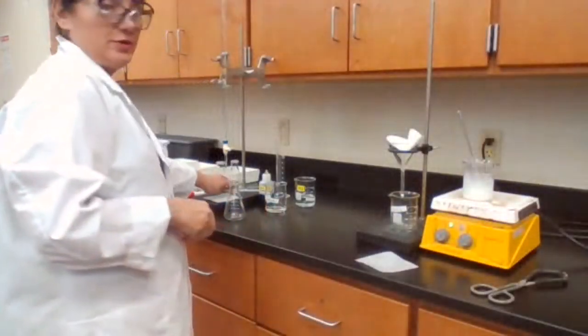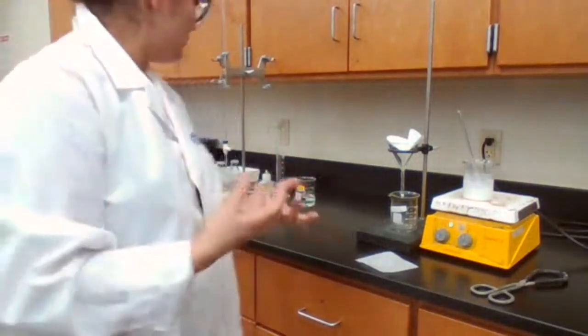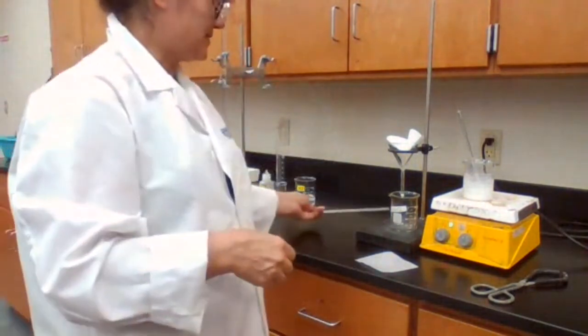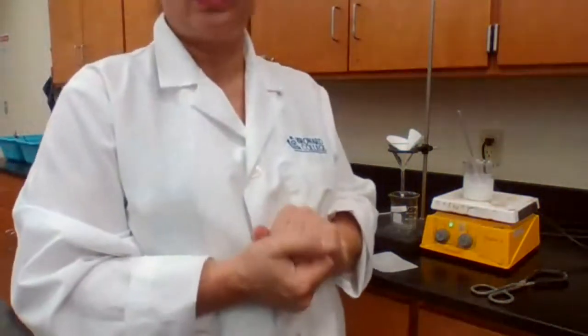The room temperature records at 22 with this thermometer. Since I'm using the same thermometer for the high temperature, it's better to record that as the temperature of the room. So T1 is 22 degrees Celsius.